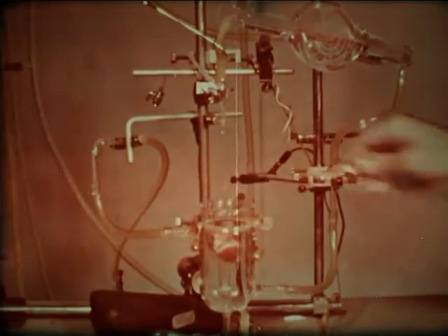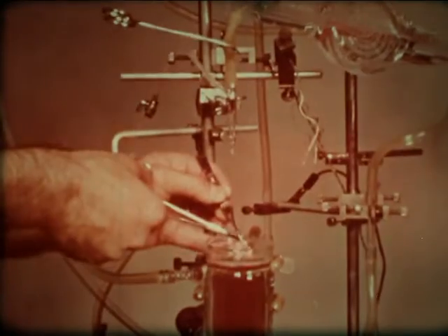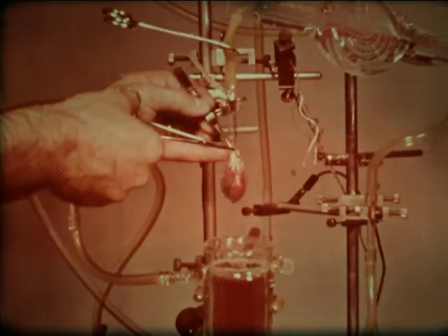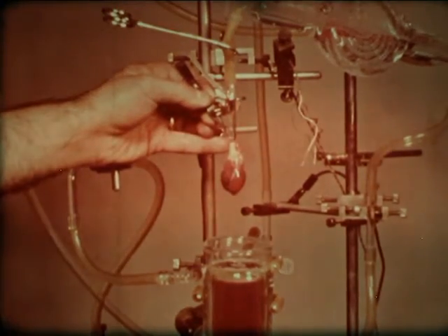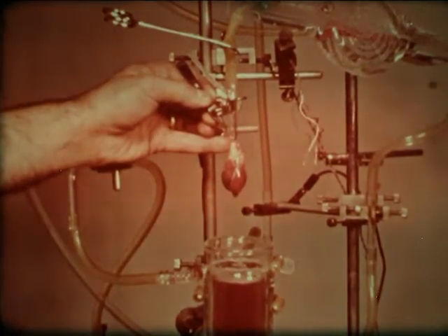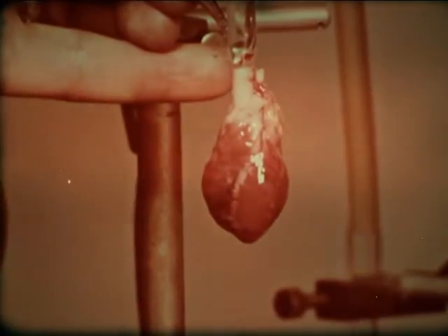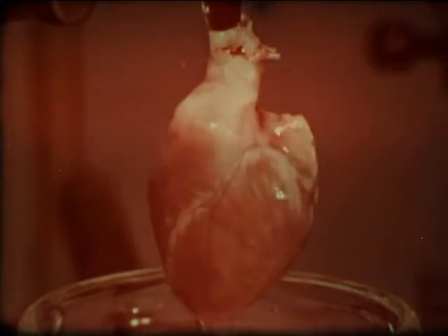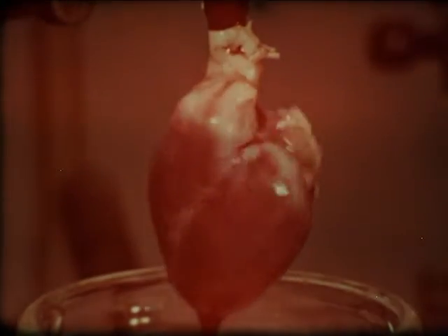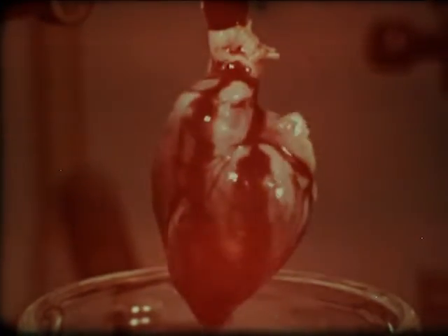A freshly excised rabbit heart is placed in nutrient solution. The ascending aorta is secured to an inflow cannula through which nutrient solution may flow under a pressure similar to the normal diastolic aortic pressure. The tip of the inflow cannula lies just outside the aortic valve so that perfusion is directed into the coronary vessels. The injection of defibrinated blood into the inflow system outlines the coronary arterial bed, illustrating the perfusion pathway.